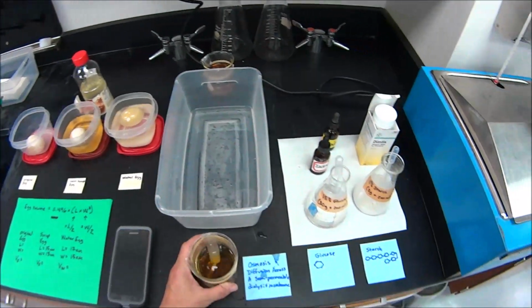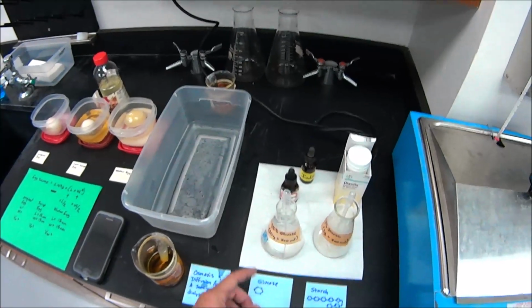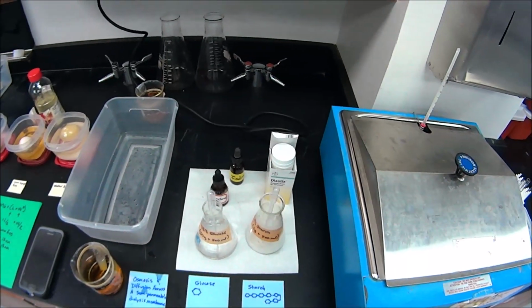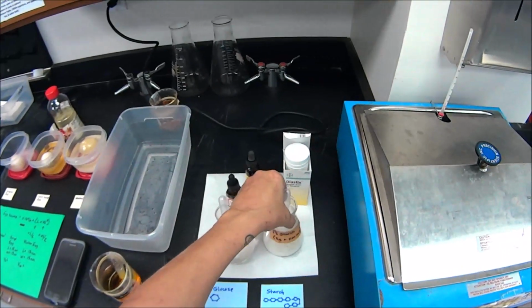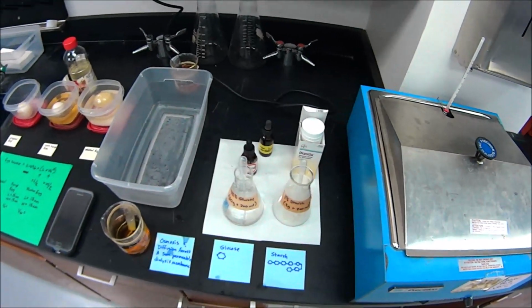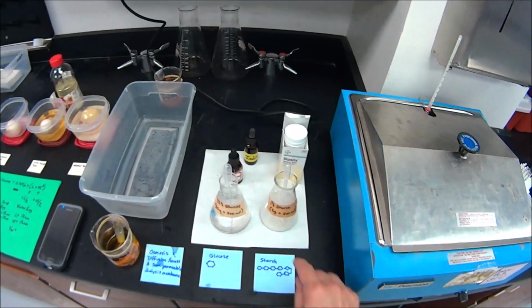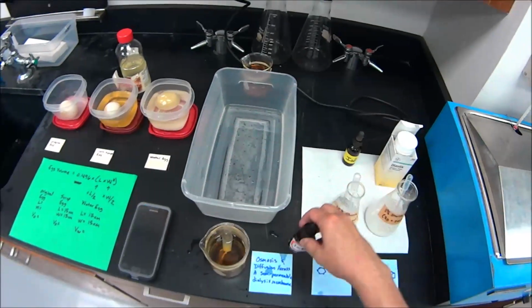So here's the principles. Glucose, right here, is a simple carbohydrate. It's a monosaccharide, mono meaning there's one sugar molecule in it. Starch, on the other hand, is a complex carbohydrate. It is made up of many repeating sugar units. A starch is a complex, large polysaccharide. Okay, so remember what I said about the dialysis membrane or a semi-permeable membrane. It has fixed pores that only allow small things through, and big things are going to have a hard time coming through.